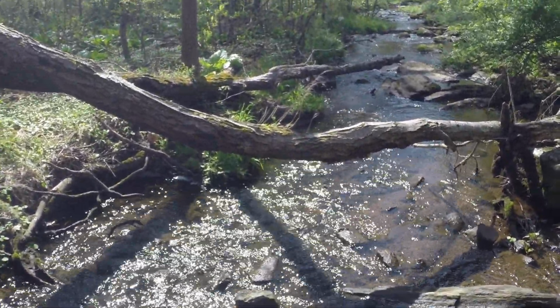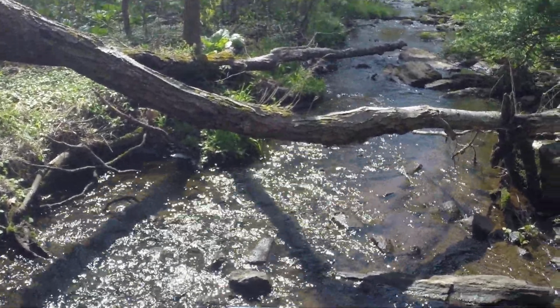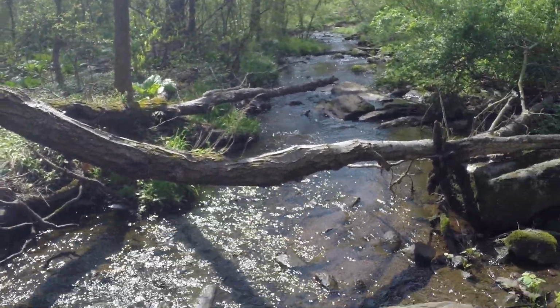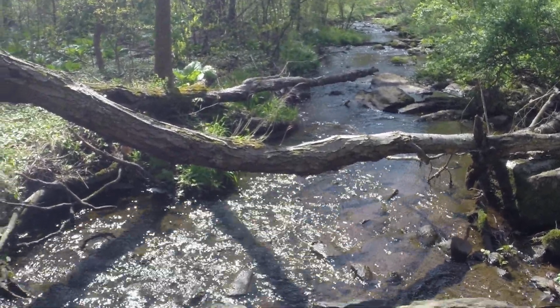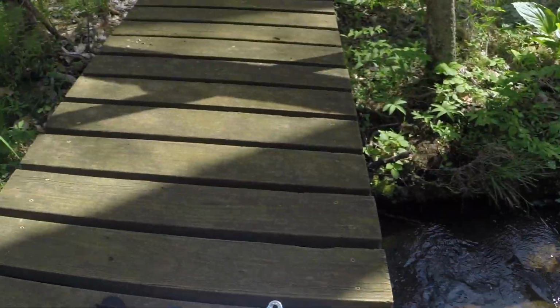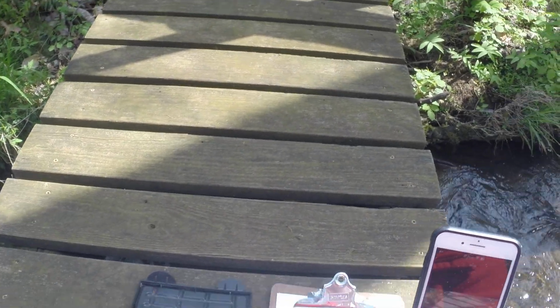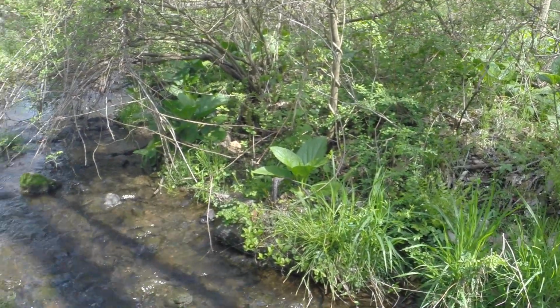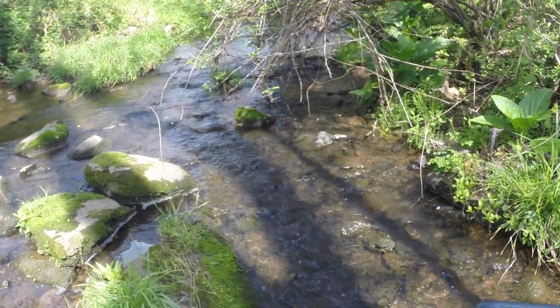We would also see signs if the water was polluted. Remember, we did those other assessments. So looking at the color, we didn't talk about smell, but smelling the water. If it smells like eggs, or a rotting smell, that's obviously not good. So you have to put all of your data, all of your findings together. And our timer has 2 minutes and 13 seconds left, and then we will read what it says. And your teachers will be given an assessment sheet of the stream study to help you review what you've learned in these videos.